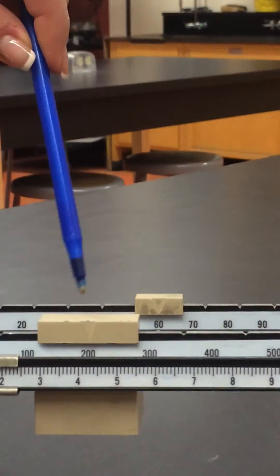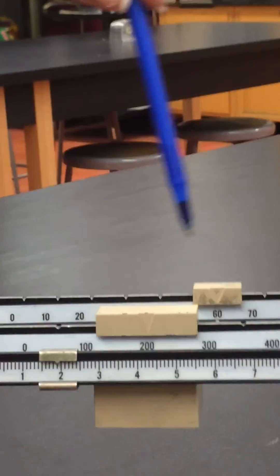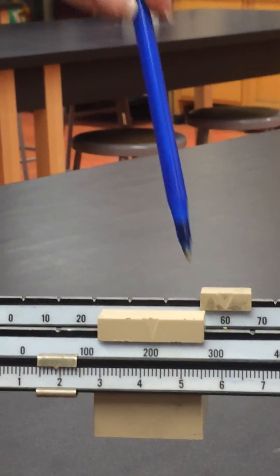Now you're going to add up 200 plus 60. That's 260 plus I would say this is 1.9. So 261.9 grams. And that's it for the tutorial.